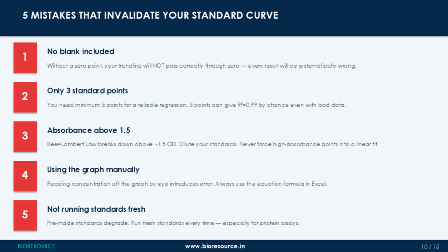People draw a horizontal line from the absorbance value, find where it hits the trend line, and then read the concentration off the axis. The error in this approach can be enormous. Always use the equation formula in Excel.